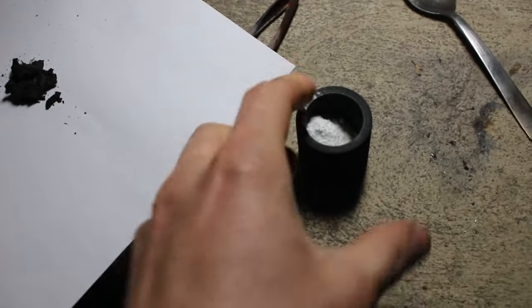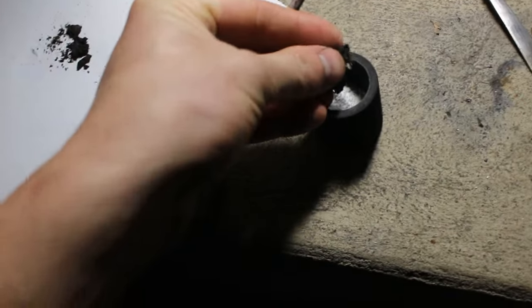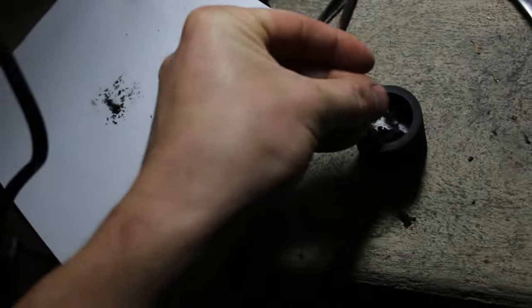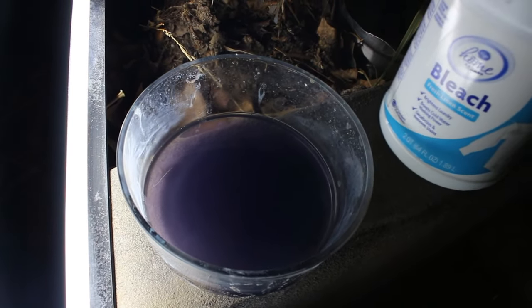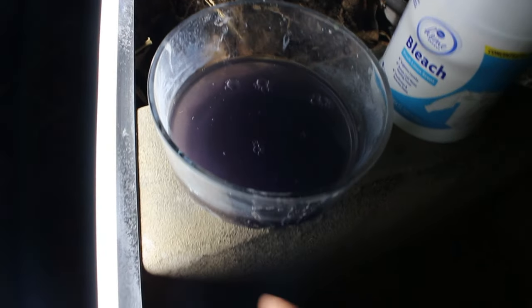Just like last time, I've got some borax flux in a crucible. I'm going to add in this cementation slime that I filtered out of the cyanide solution. For those of you worried about the leftover cyanide solution, it's nothing a little bit of bleach won't be able to take care of. Just throw that in there — goodbye cyanide.